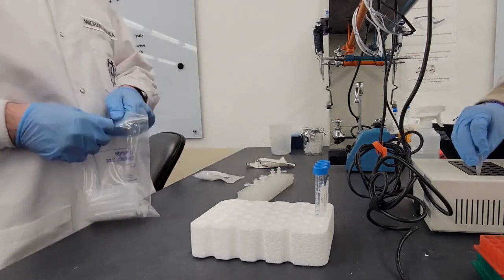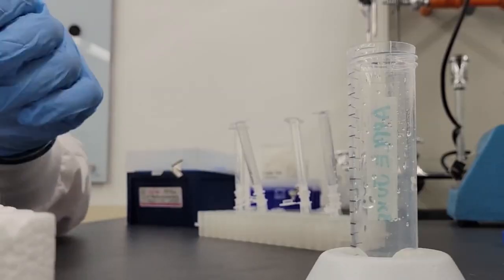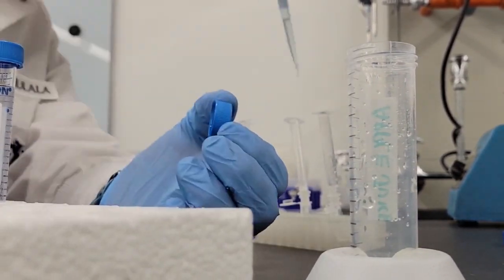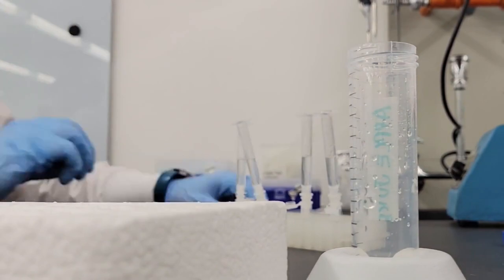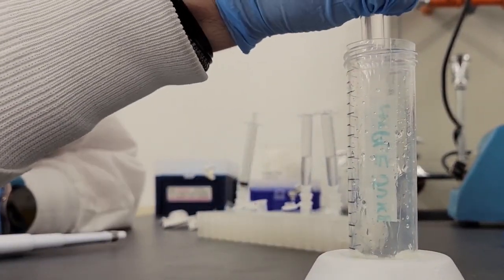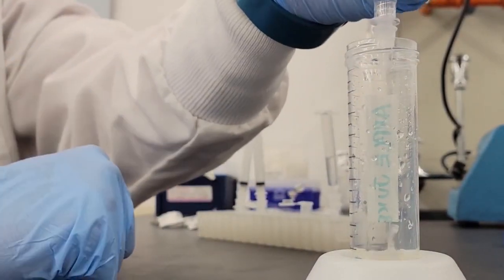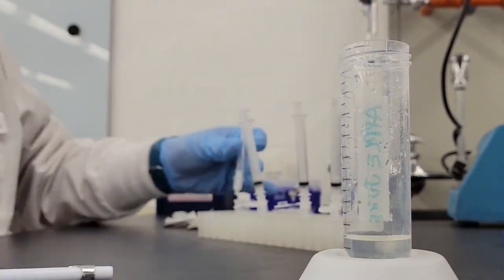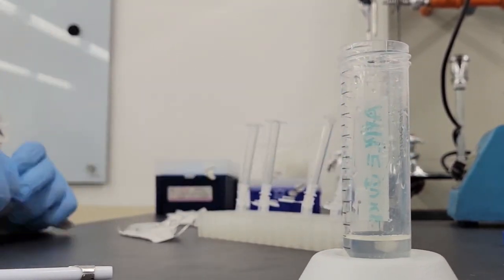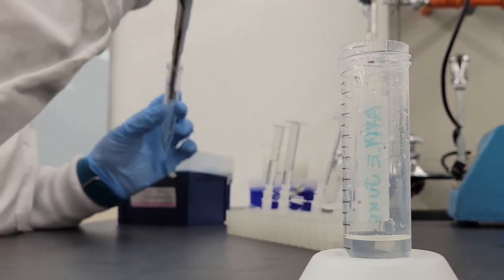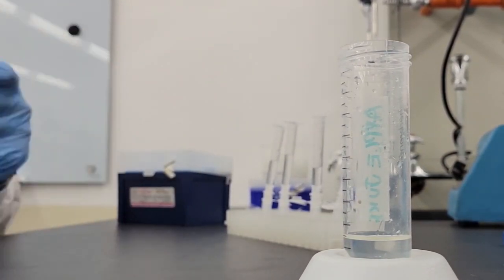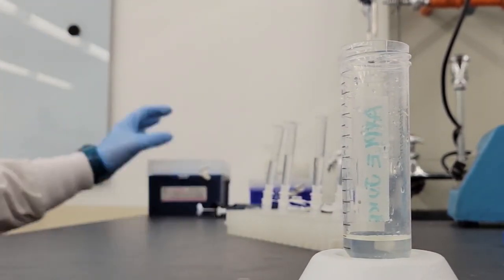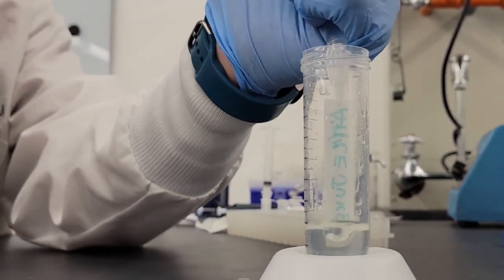Thank goodness those two minutes are up. Now we're going to take something called columns, which are just these little chambers, and we're going to pipe the entire solution through a certain amount of columns. We don't want too much in one, otherwise we can't exactly clean it up. The columns inside have a special chemical that is going to bind to the beads. And because the beads have binded to the DNA, by extension they are also holding on to the DNA. All the other gunk is going to flood through, but it might actually be caught somewhere. So we need to make sure to actually fully clean it up. So we're going to run through a little bit more of isopropyl alcohol, which is going to disinfect it and clean it all up. We're going to do this like three times. And while we're doing this, we're pushing at an extreme amount because we actually have a vacuum in there. So it's going to hurt your hands and speed run carpal tunnel. And the output we put into a single flask, which you're supposed to call trash, but I like to call it apple juice.